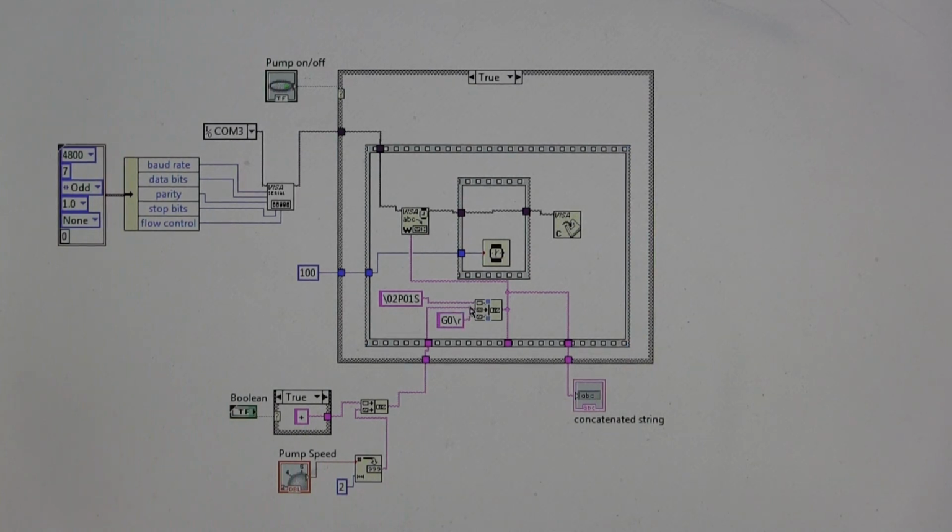Now we wedge that in between these two others, and so we have the backslash O2 P01 is the pump, or the initialize and the pump, and then S is the command to set the pump speed and direction. So we're setting the pump speed and direction to the plus 300, 200, whatever it is. And then we have the G0 backslash R, which G essentially means go. And G0 in this case means go continuously, keep running until you receive a halt. The Masterflex pump does have an option to operate for a certain number of cycles, but in our case we just wanted to run continuously, so that's what we have here.